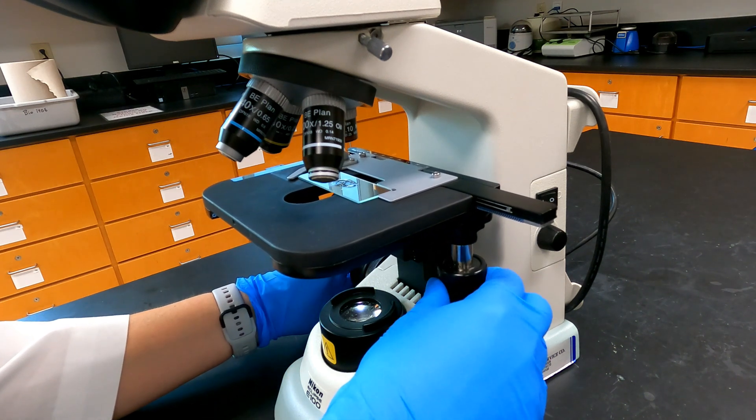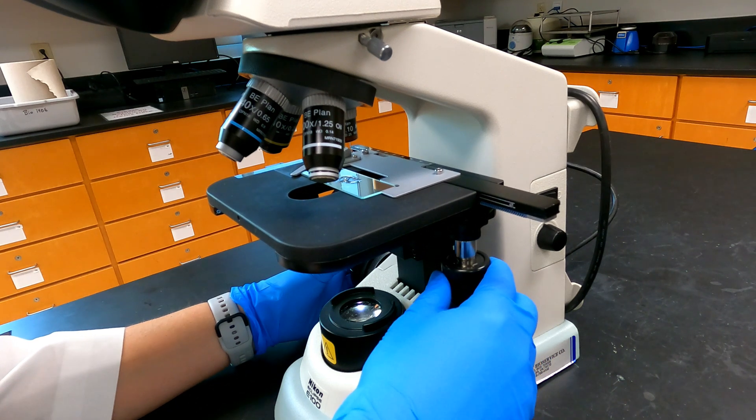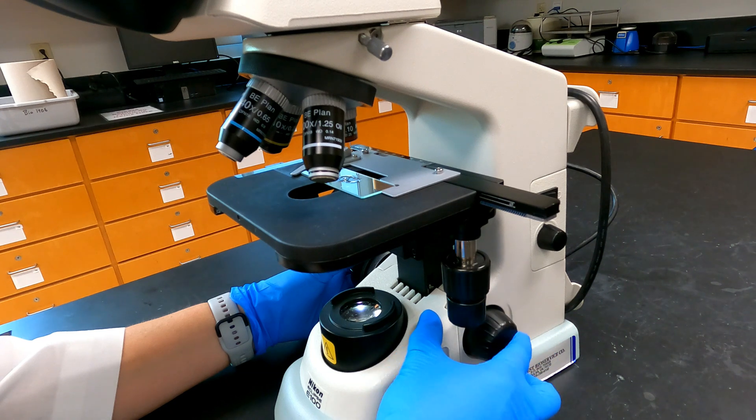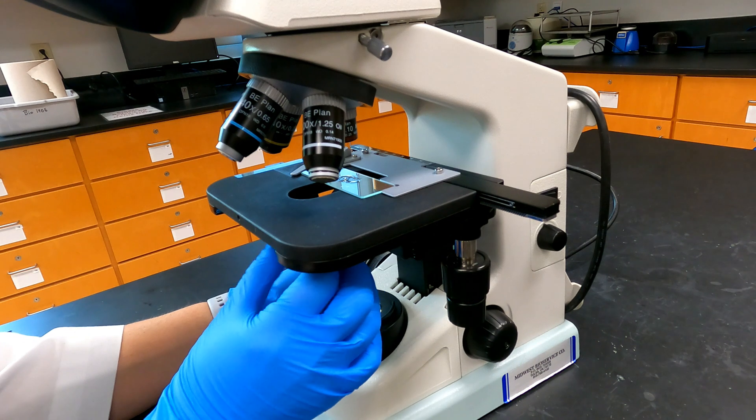Look through the ocular lenses and slowly move your stage down until the Daphnia is in focus, and then use the fine focus knob to fine-tune your focus to clearly view the Daphnia. If the heart is difficult to see, adjust the condenser diaphragm to limit the amount of light passing through the Daphnia, thus increasing contrast.